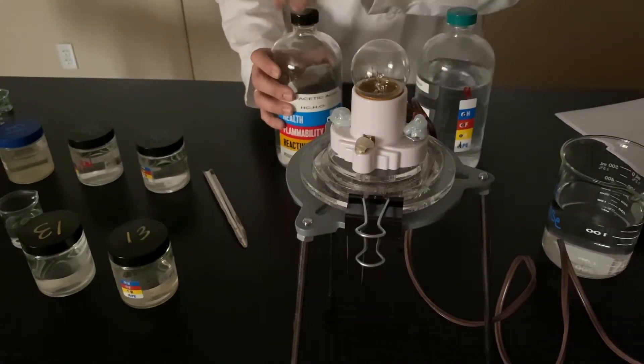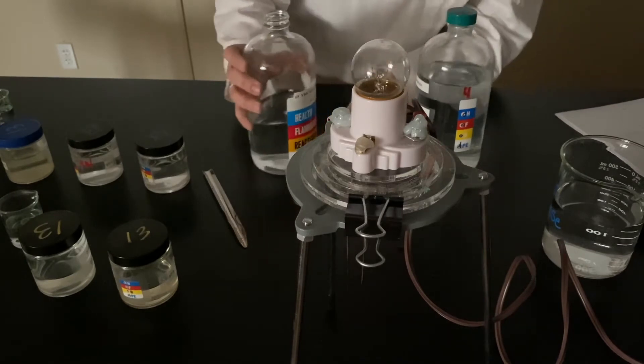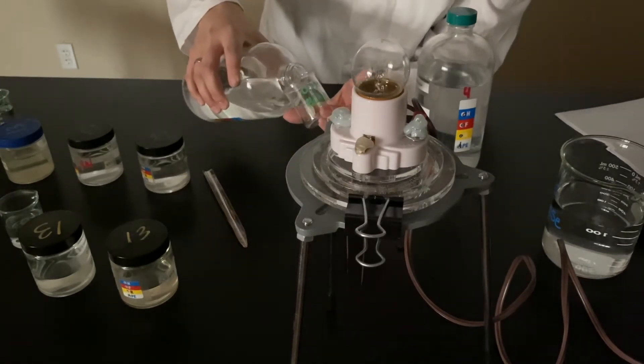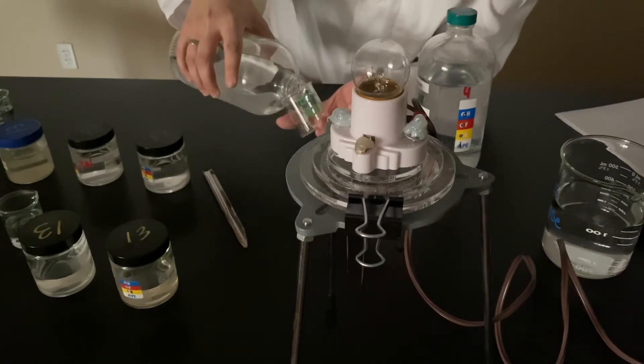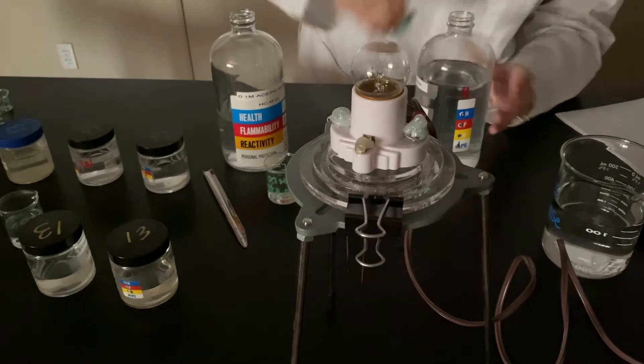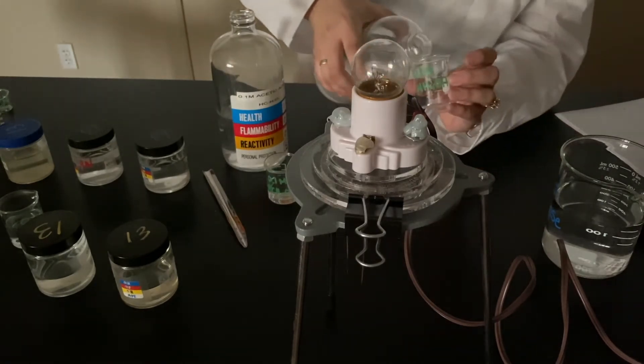So another double replacement reaction. We are going to be mixing acetic acid with some ammonium hydroxide.